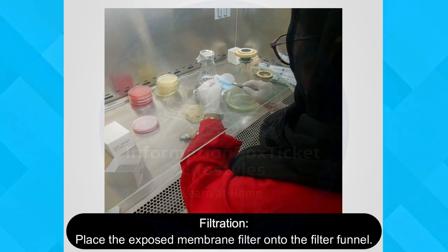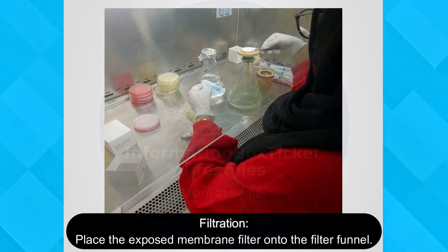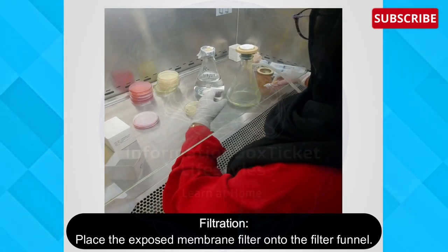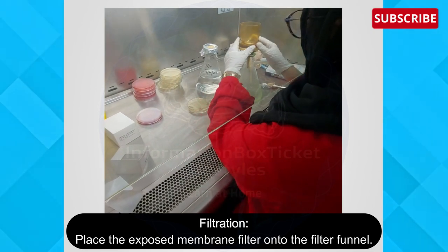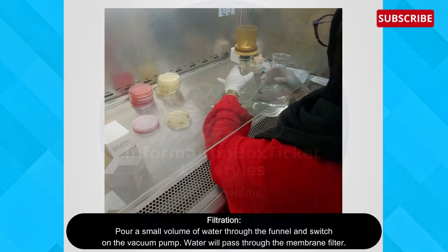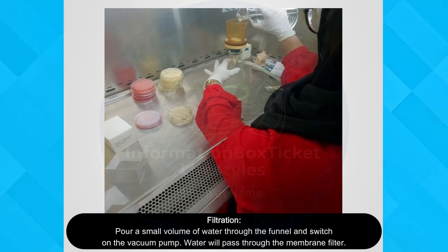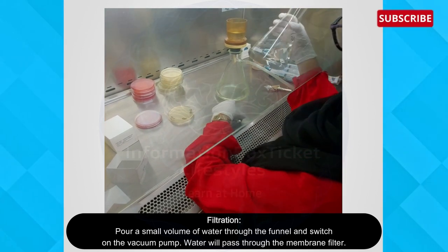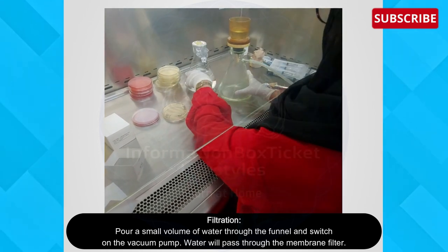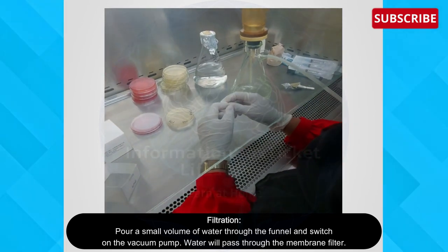Carefully place the exposed membrane filter onto the filter funnel and place back the filter funnel on top of the filter membrane. Now, pour a small volume of water through the funnel and switch on the vacuum pump. Water will pass through the membrane filter.